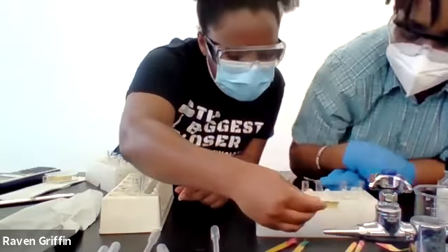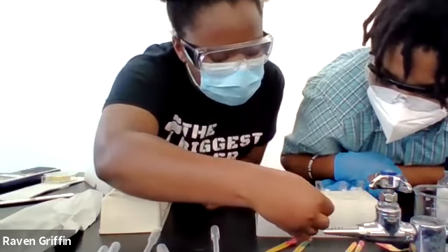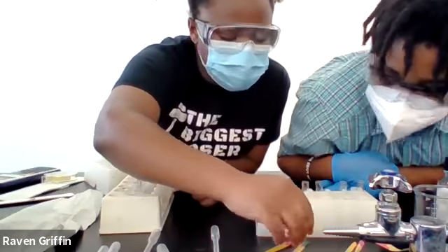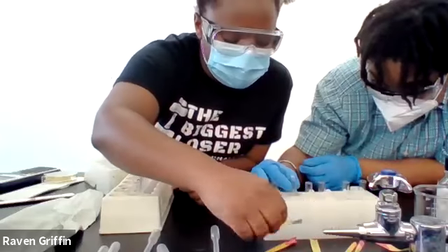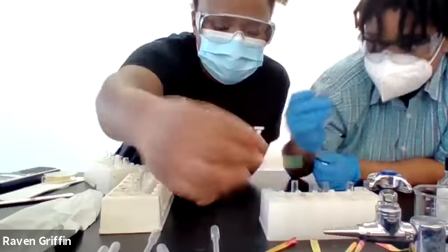Ammonia, that was the dark green one, right? I think it was yellow. Yeah, this one kind of got touched by some other stuff, but I'm pretty sure it was yellow initially. It's kind of funky now with colors, but it was yellow initially. NaOH, is this green? In green.